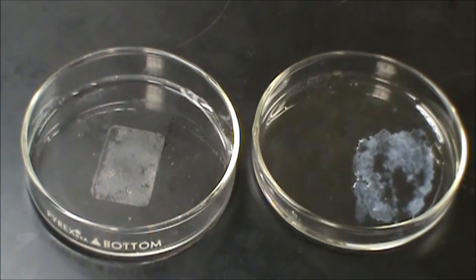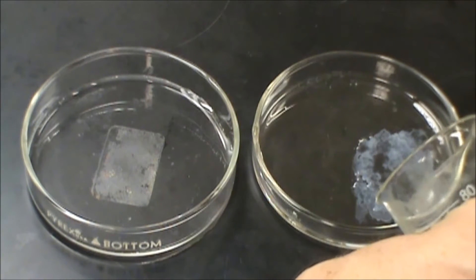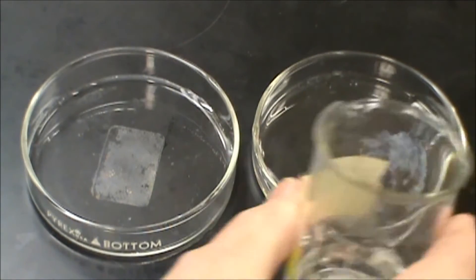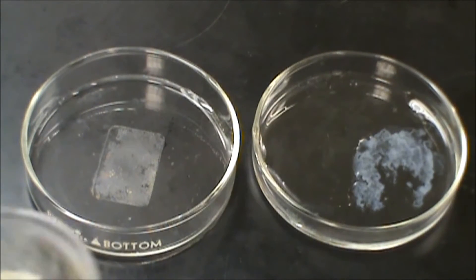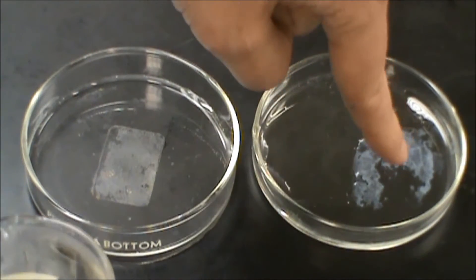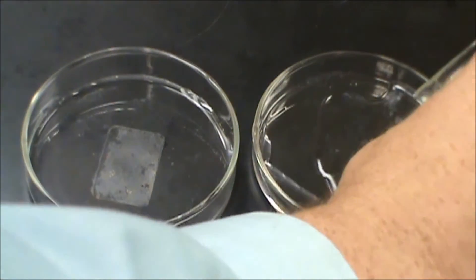And the other one, I'm going to take the zinc hydroxide and I'm going to add acid to it. And I'm going to try and do this just on the one side at first so you can kind of see this. So now we can see that it's starting to react with the precipitate. And then I'm going to add a little more over here.